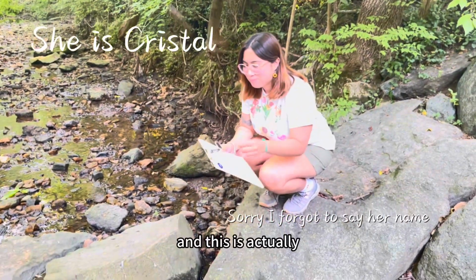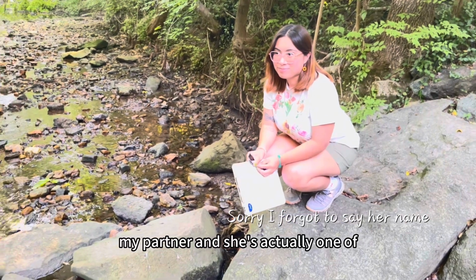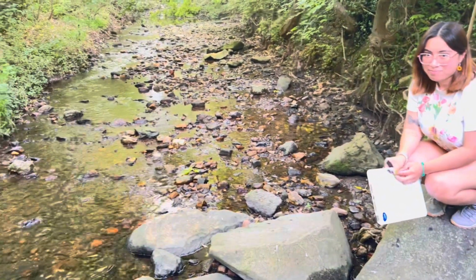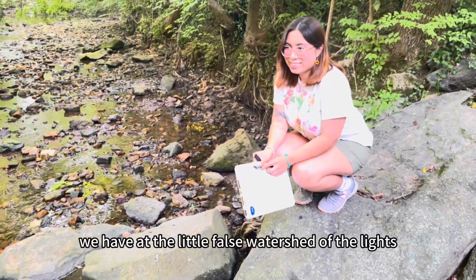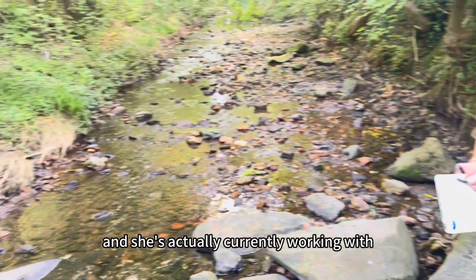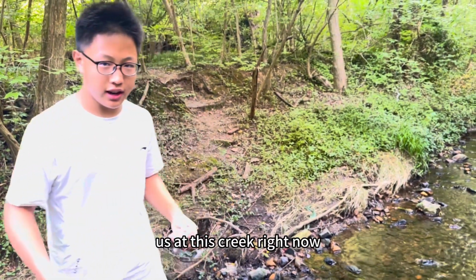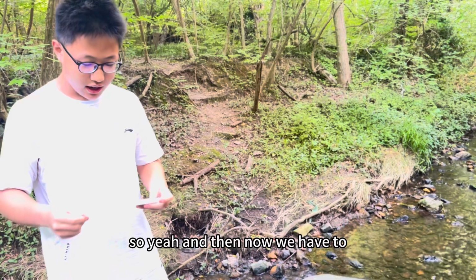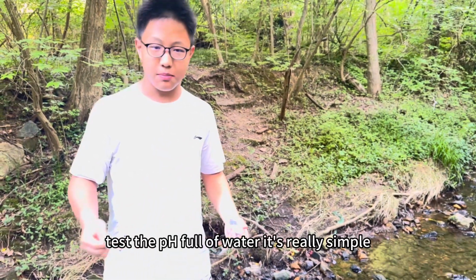And this is my partner, and she's one of the supervisors at the Little Falls Watershed Alliance, currently working with us at this creek. So now we have to test the pH for the water.